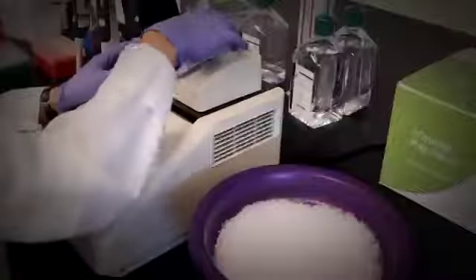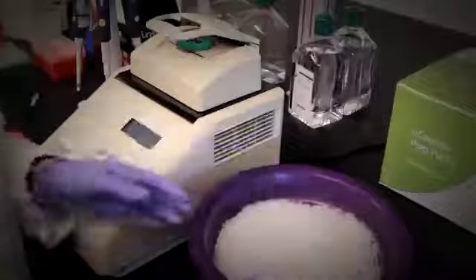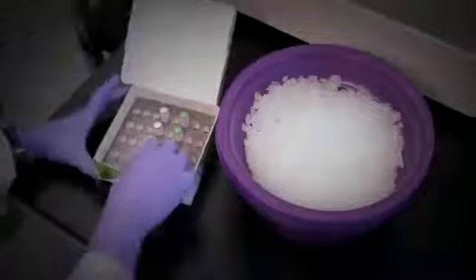You'll need your samples processed with the microRNA sample preparation protocol, which is described in another tutorial video. You will need a tube of the n-counter microRNA capture probe set and a tube of the microRNA reporter code set, which is stored at minus 80 degrees C.